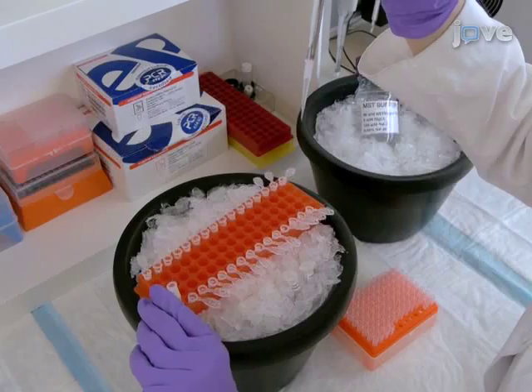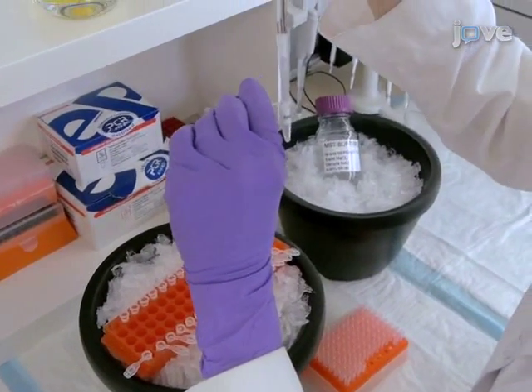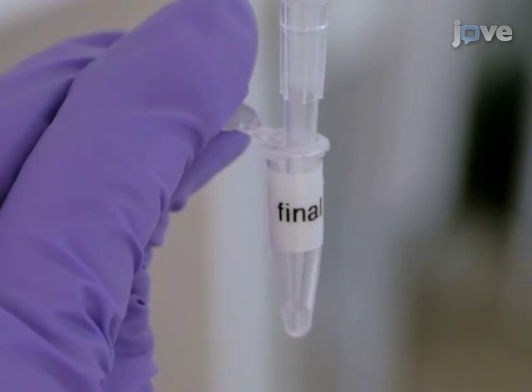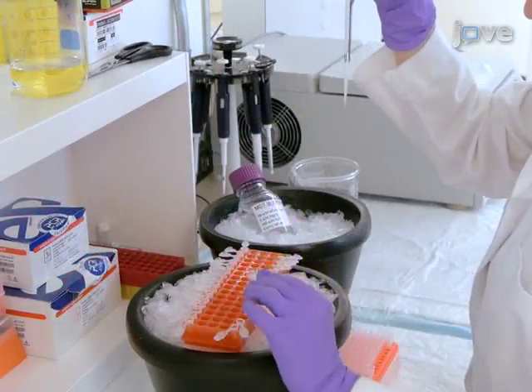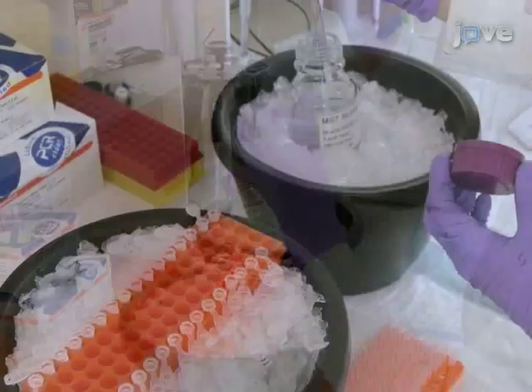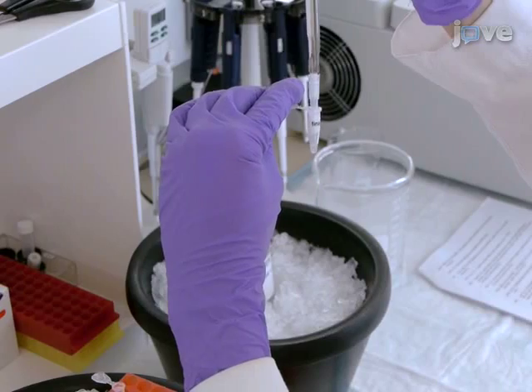Add 15 microliters of the ligand sample with the highest concentration to the corresponding tube number 1 with the cell lysate. Mix well and change the pipette tip. Repeat this step with the rest of the tubes except for the last one, which should contain no ligand. Add 15 microliters of MST buffer to the last tube and mix well.